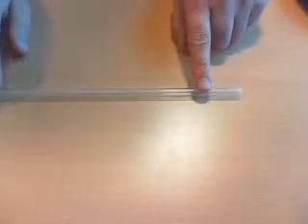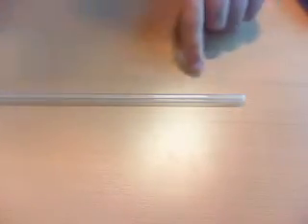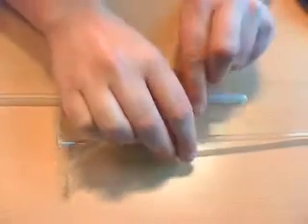The glass rods we need look like this. This is the sample rod and the sample will be placed down at the bottom. It's a long glass rod and quite fragile. To avoid getting any sample on the inside walls, we use a fairly long funnel to put the sample inside the capillary. Because it's very fragile, this is done very carefully.